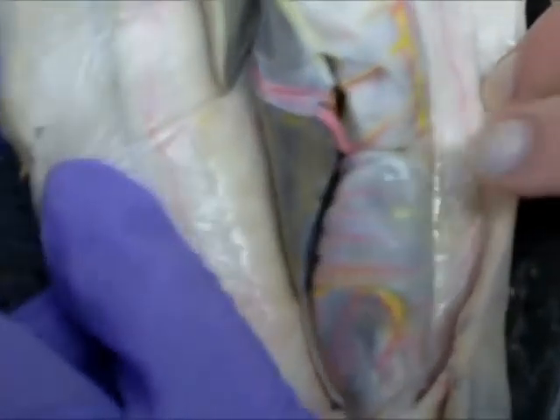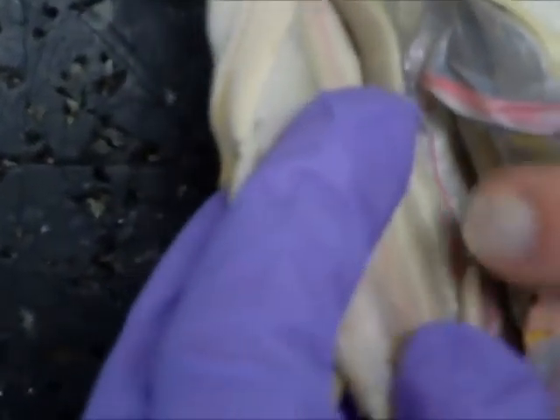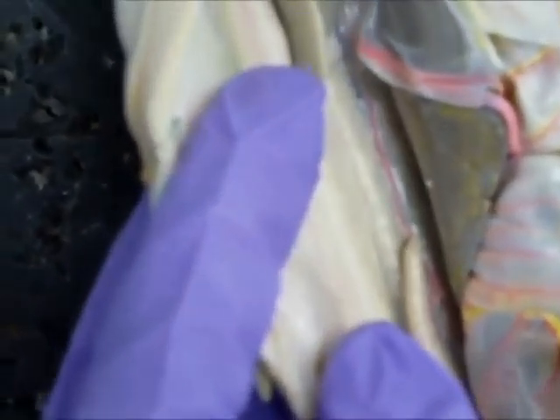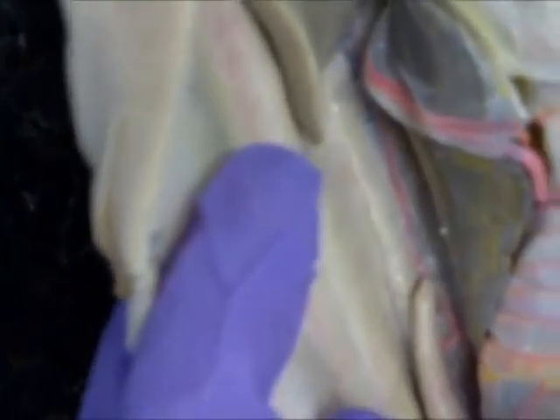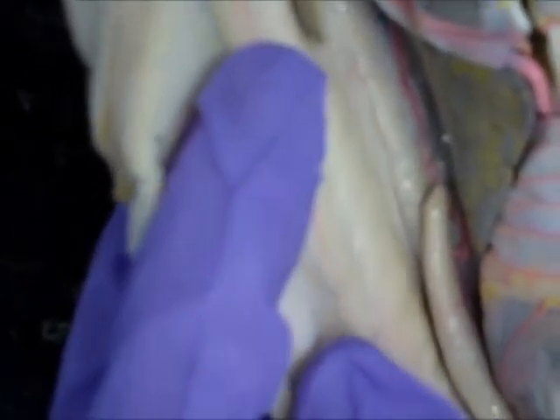There's the spleen again — the other side. And in here is the digitiform gland.